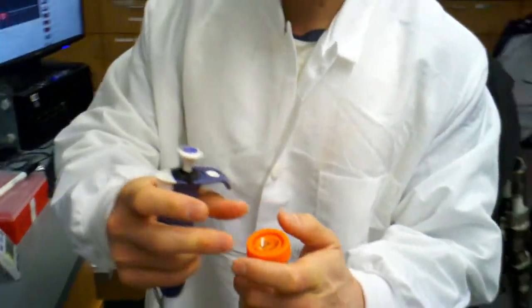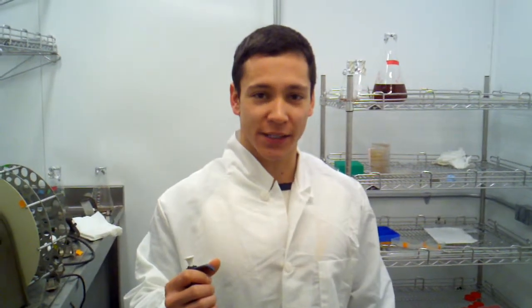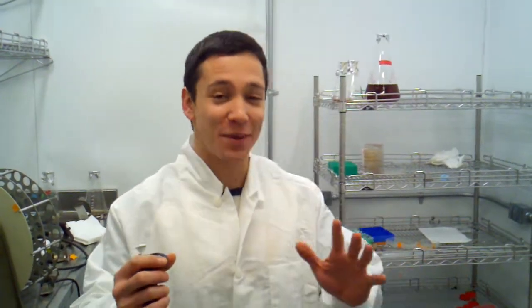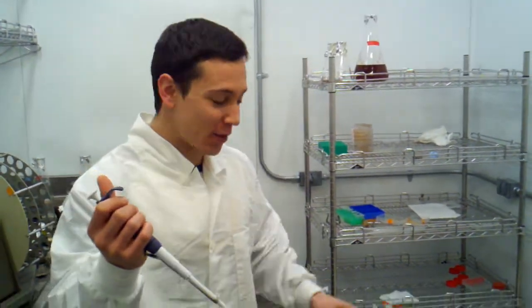Open it up. Maybe you should be using sterile technique, but... We're here in the minus 30, or I keep on saying minus 30, I don't mean minus 30, 30 degrees, and we're going to add our arabinose to our cells.